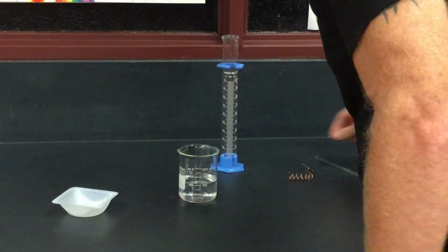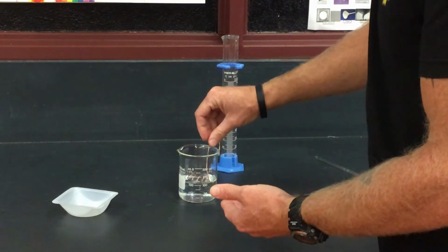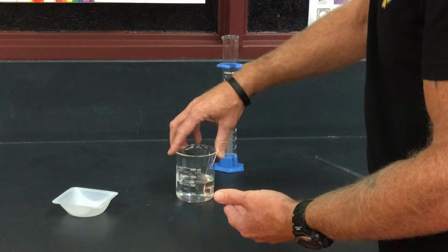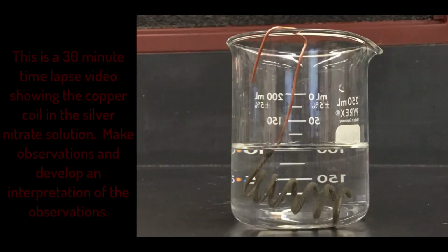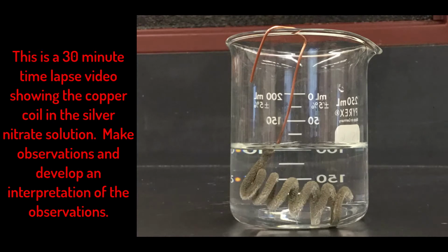If it is not already done for you, form a coil of copper by wrapping it around your pencil several times. Place this coil of copper in the silver nitrate solution. Allow the beaker to sit for a period of time while you make observations and interpretations of those observations. You can see what happened in the beaker during this time-lapse video over a 30-minute span.